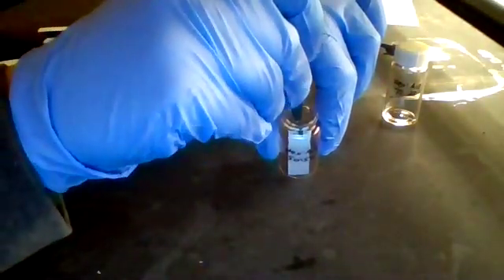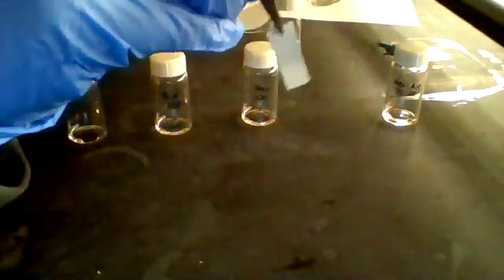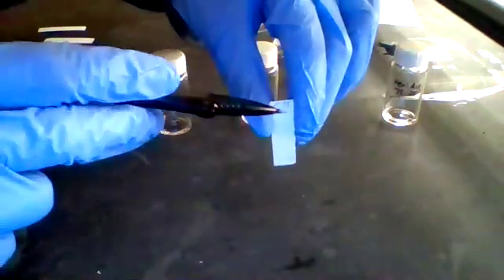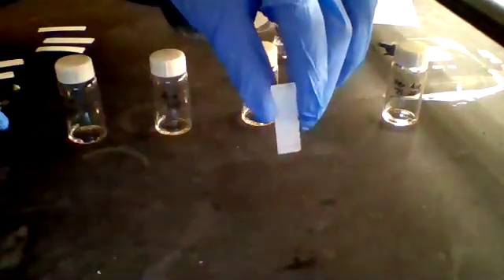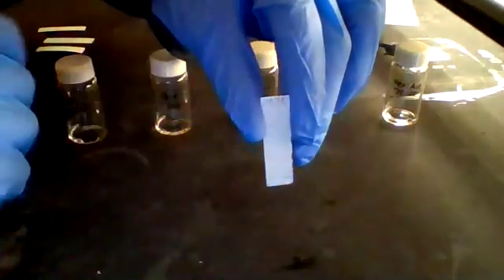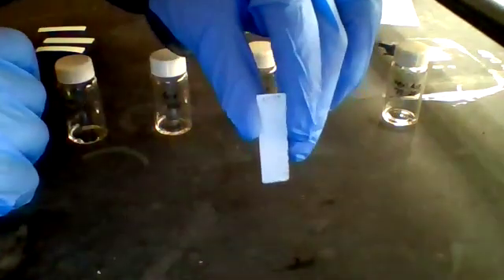All right, so once the solvent line gets pretty close to the top of the TLC plate, we remove it from the solvent chamber, and then very quickly we would mark it with a pencil as to how high the solvent line is. And then I annotated this TLC plate to read that it was the 50-50 mixture.